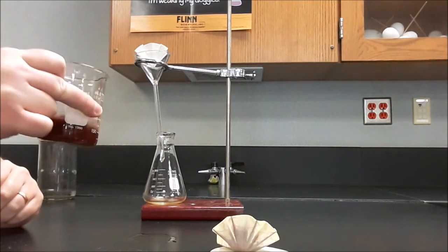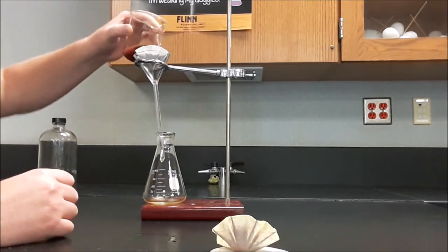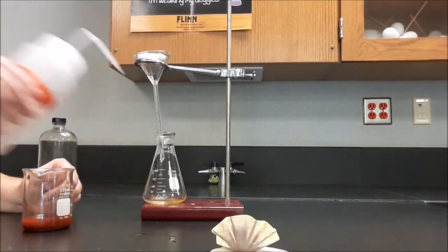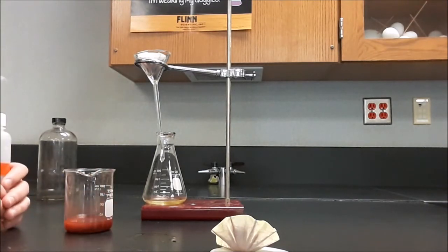Take my beaker, swirl it. We don't want the filter paper to overflow. And you know what? Now that I'm looking at it, I've already messed this up. What I should have done is I should have rinsed the flask into the beaker with some DI water, to get all of the yellow out that didn't move over when I dumped the flask into the beaker the first time. If I had done that, I would see the filtrate is actually colorless this time. All of the yellow is gone.